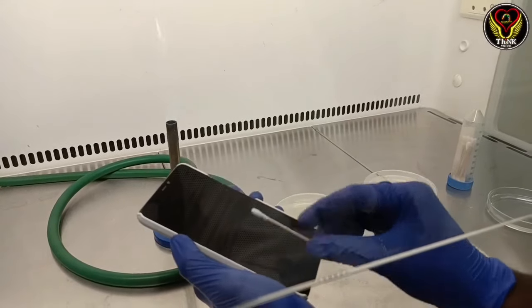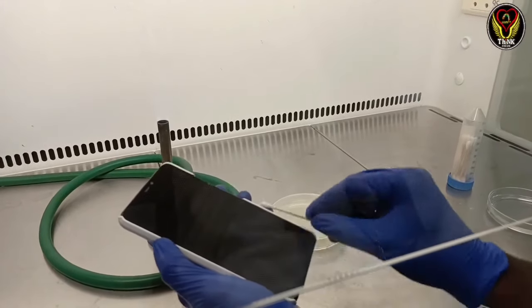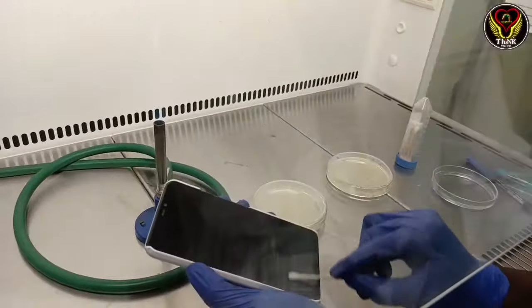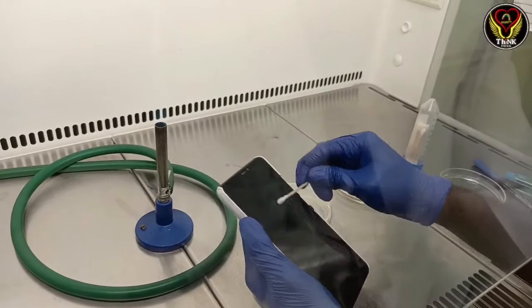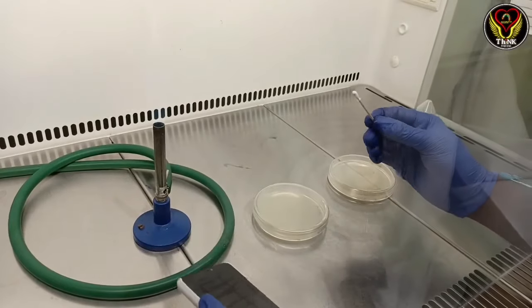At the same time, I will rotate the swab. I will rotate the swab to collect all the bacteria from the surface.